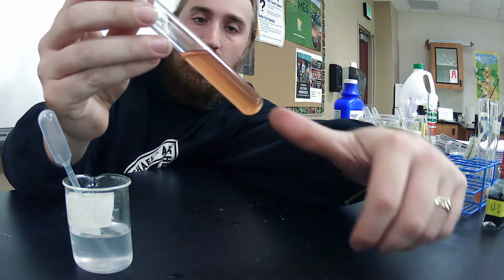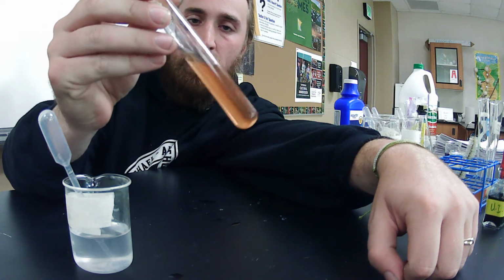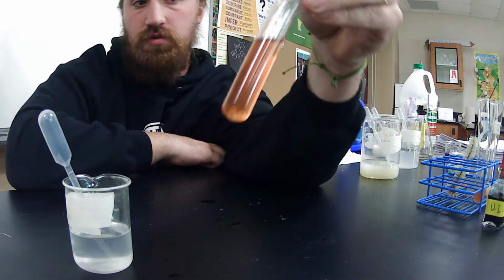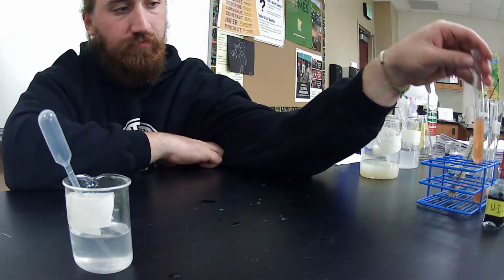Okay, this is now an acidic solution. I overloaded my milk of magnesia. I overloaded my buffer, which is a strong basic, and turned this into an acidic solution. This worked for a long time to help maintain homeostasis in the body.